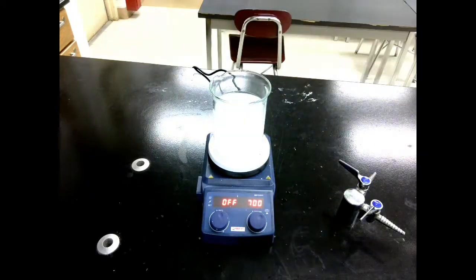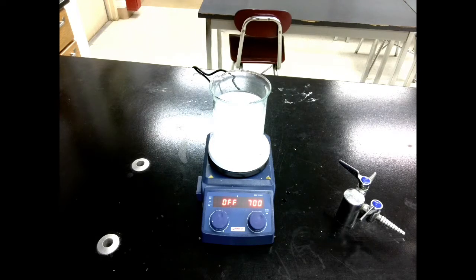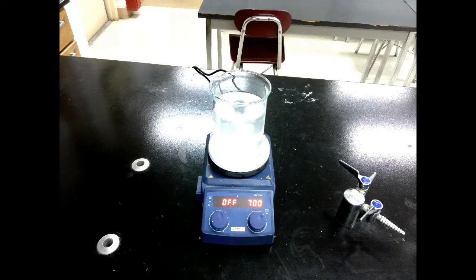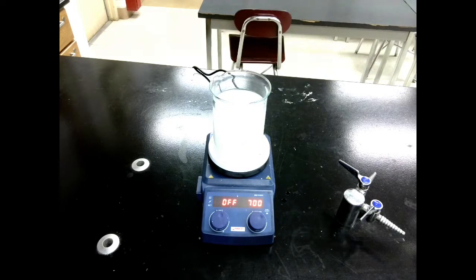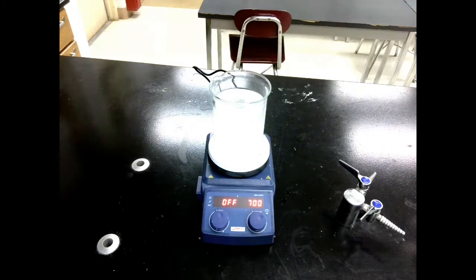While we're waiting for that to cool down, we can go ahead and create a concentrated sodium chloride solution. Do this by just adding some distilled water to a 600 milliliter beaker, and then adding sodium chloride and letting it stir for a while, and keep adding the chloride until it doesn't dissolve anymore. Once we hit that point, just decant off some of the solution and we'll be ready to use it.